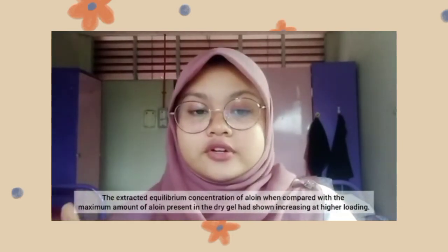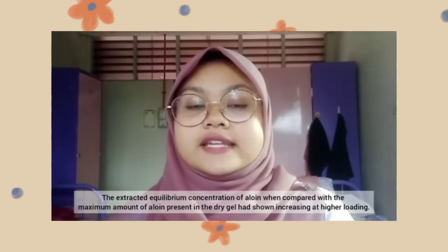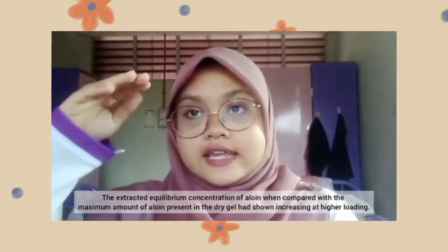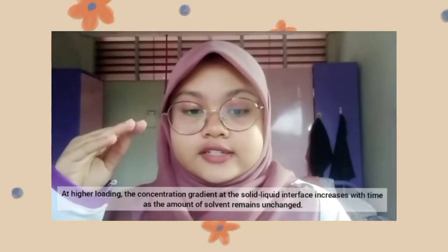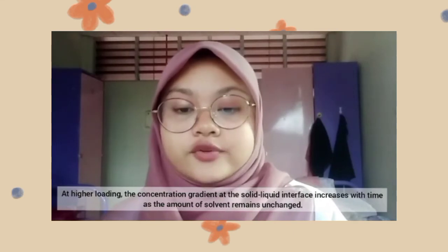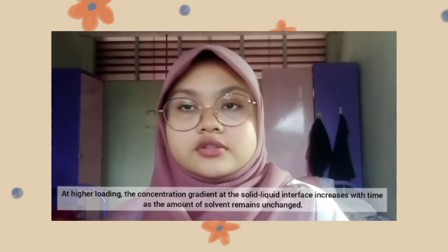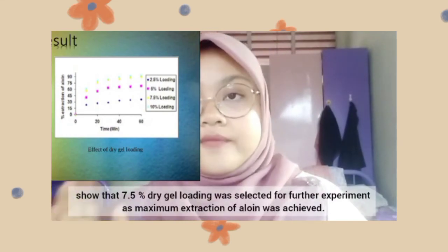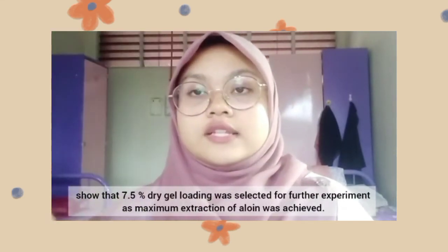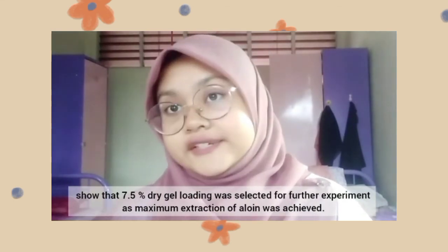The extract equilibrium concentration of aloin, when compared with the maximum amount of aloin present in the dry gel, had shown an increase at higher loading. At higher loading, the concentration gradient at the solid-liquid interface increased with time as the amount of solvent remained unchanged. We can see from the figure of the effect of dry gel loading that 7.5% dry gel loading was selected for further experiments as maximum extraction of aloin was achieved.